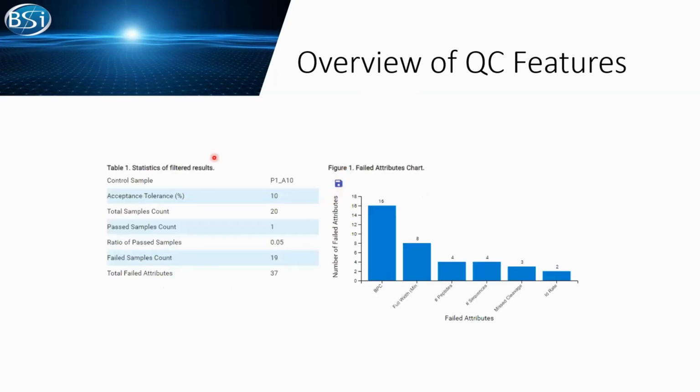Here is a general overview of the attributes status that you select to watch. For example, in here, you can see your control samples and what you set up for the accepted tolerance and how many samples you choose to watch here. And if the sample you choose and its attributes all fall in the range that you set up previously, we consider it a pass. And we provide a ratio of the pass samples. Of course, if the attributes did not pass, in other words, fall out of the tolerance range that you set up early, we consider that a fail.